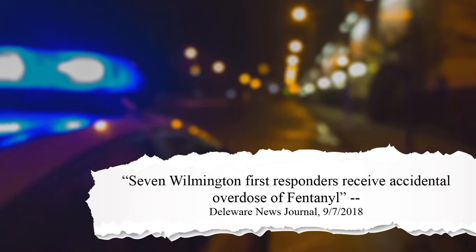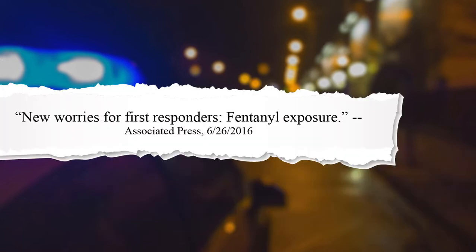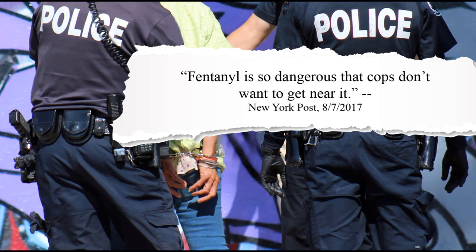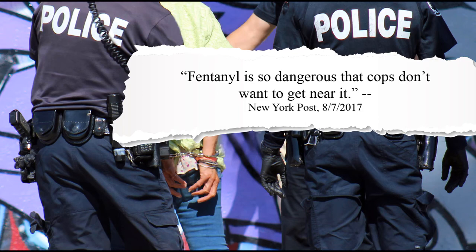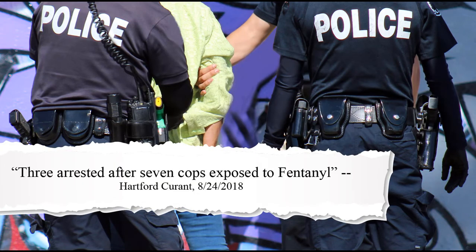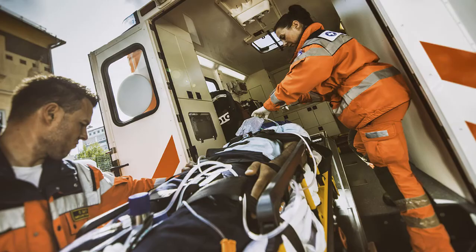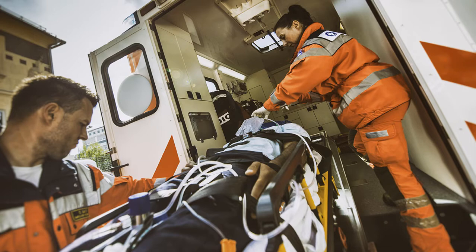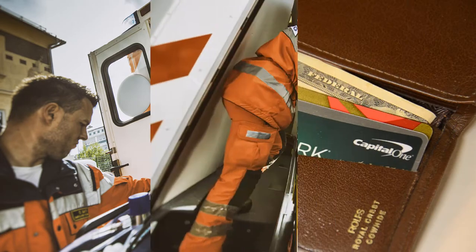Every day, first responders and investigators are faced with the danger of being exposed to fentanyl, a potent drug that can be lethal even in very small amounts. This fentanyl epidemic is growing, posing greater threats to law enforcement officials.